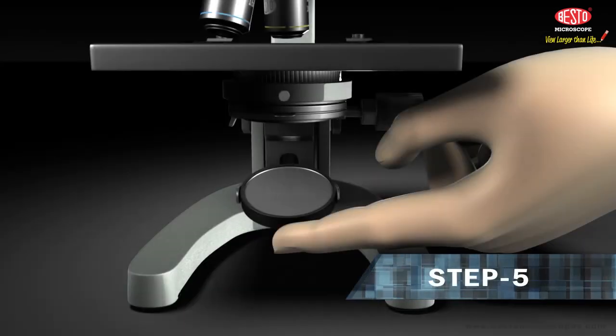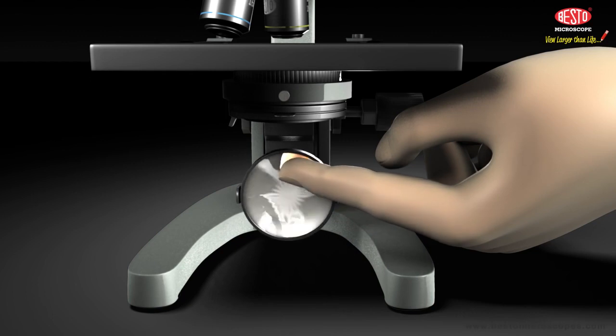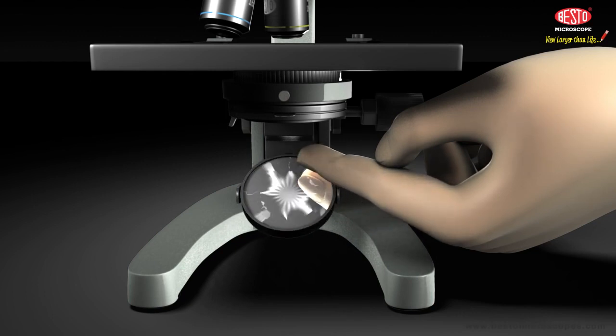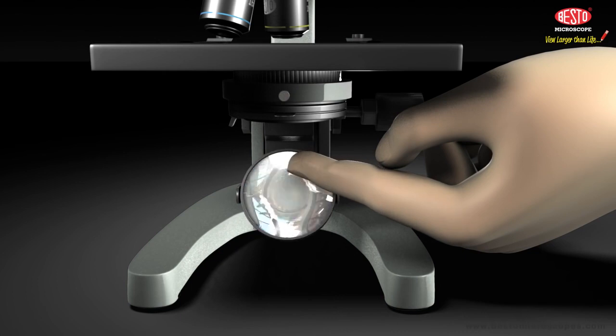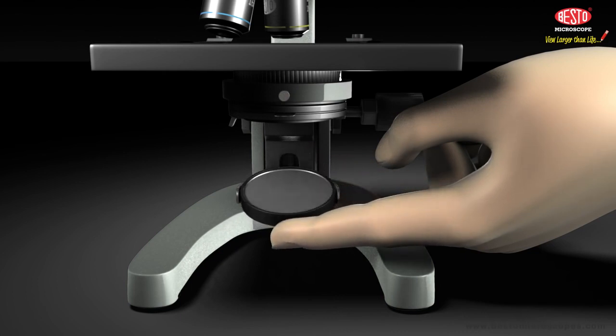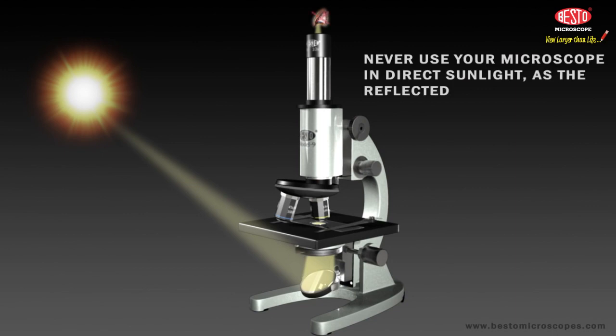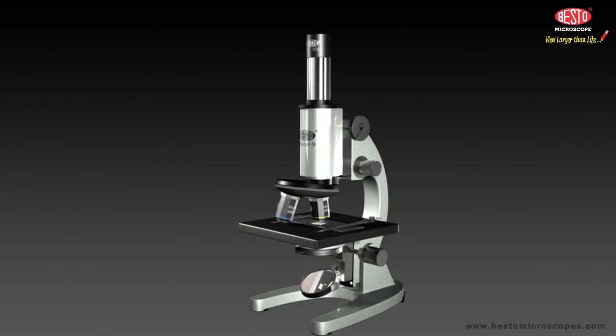Step 5. The reflector has one side flat, while the other is concave. It is difficult to say which one is best to use in every case. You will have to experiment to see which gives you a better view. The flat side will provide a sharper image in most cases, while the curved side will provide a brighter image. Here's a helpful hint for you. Never use your microscope in direct sunlight, as the reflected light could damage your eyes.